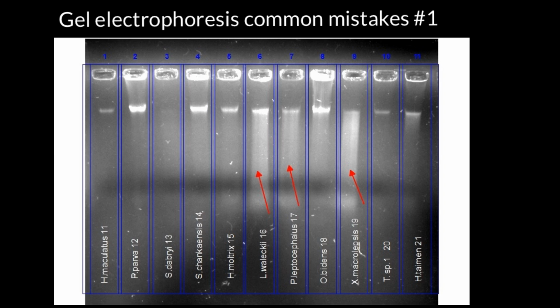So we have to include certain steps in our sample preparation in order to avoid DNases. DNase is a protein, so our steps have to include degradation of the proteins. And another source of contamination can be RNA, so we also have to degrade RNA to get a better picture. Sometimes we can also get this type of smear if our electric current is set too high. So you have to decide which mistake you made, but basically I gave you common mistakes that lead to pictures like this one.